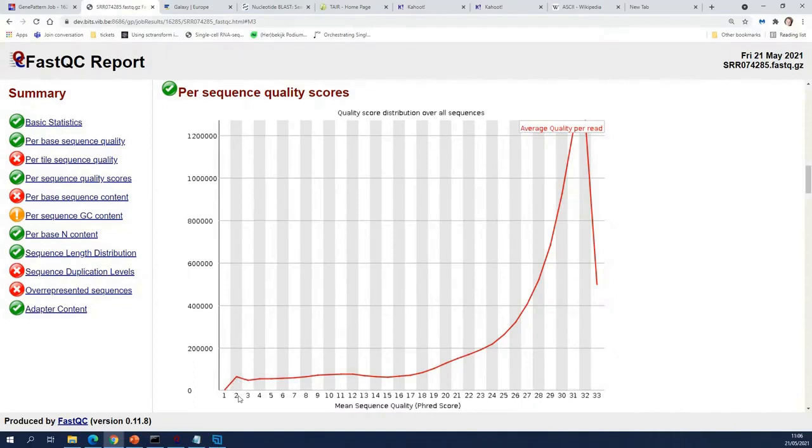When the base calling software doesn't know how confident it is, so it cannot give a quality score because it doesn't know the quality score, it will use by default a 2. And this is why you always get a small peak with reads that have an average quality score of 2. Of course, there are reads that are not okay, but you will always see it, and when it's just a small peak, there's not really an issue.